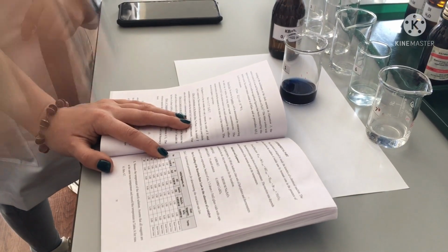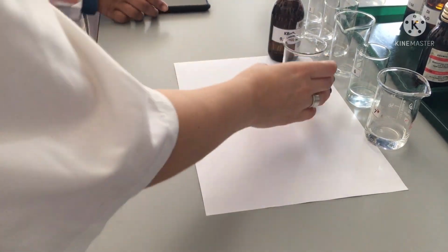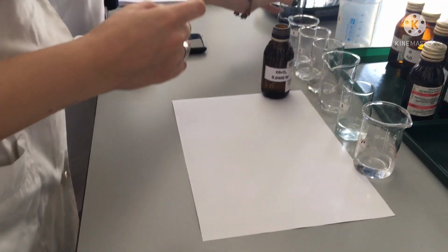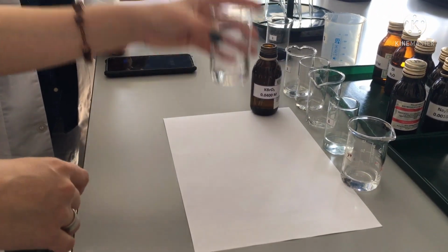Yes? Okay, so let's have the next, and then we will try to watch it. So for the next we will have another one. Let's try the second one.